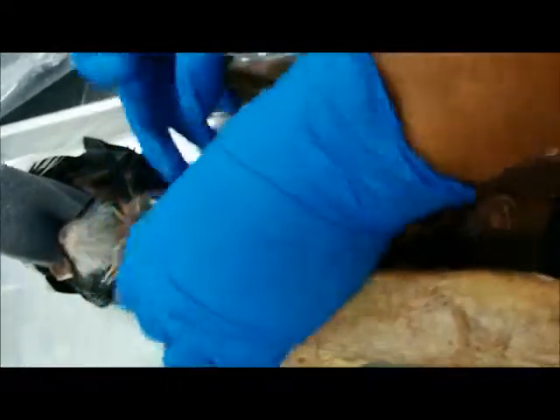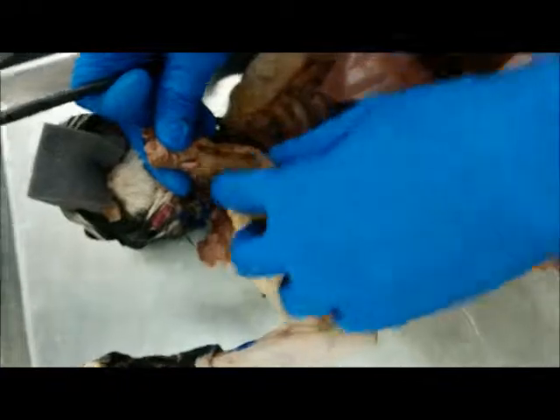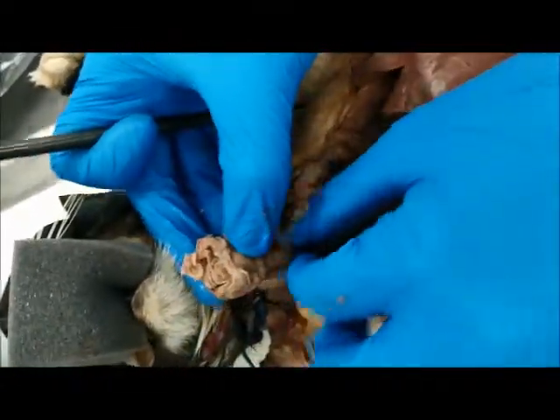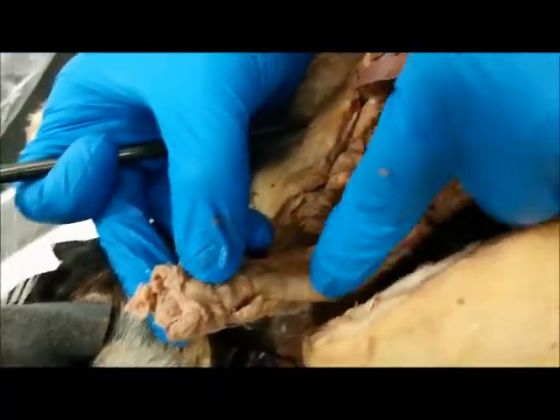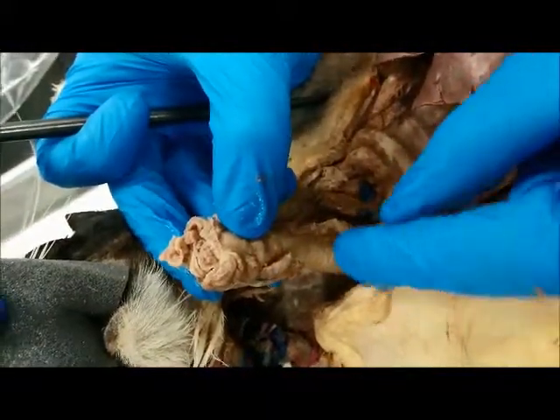Now, let's take a look at the trachea. So this is your trachea right here, and behind it is the esophagus right here. The esophagus is this smooth tissue, and the trachea is this. The trachea has a C shape right here. You can see those lines going across. Follow my finger. That's a C shape of the trachea, and it serves several main functions.